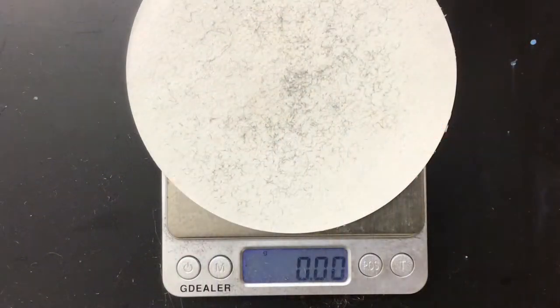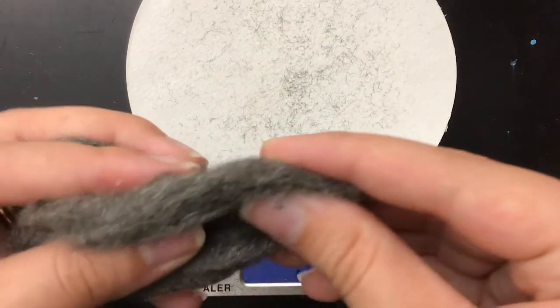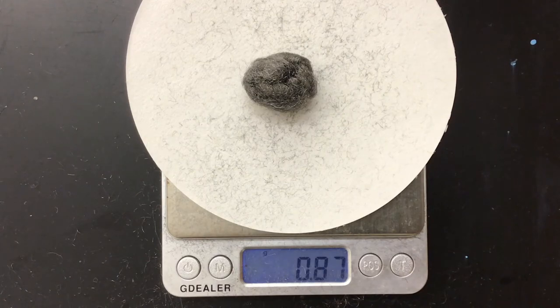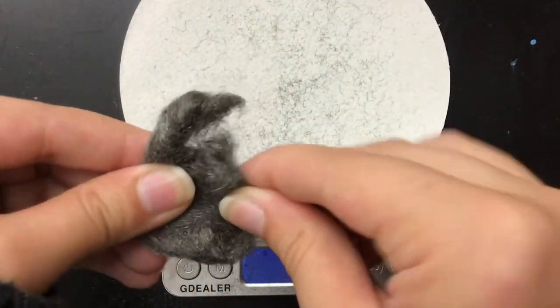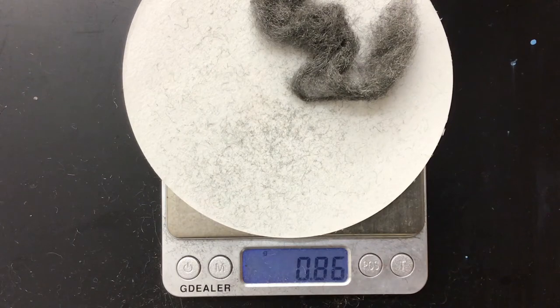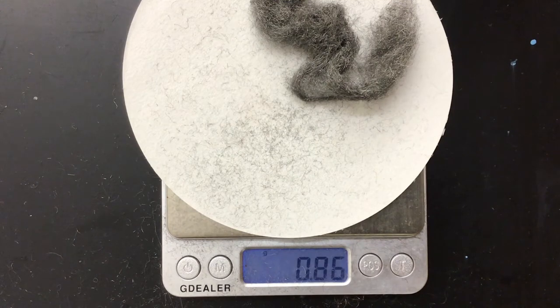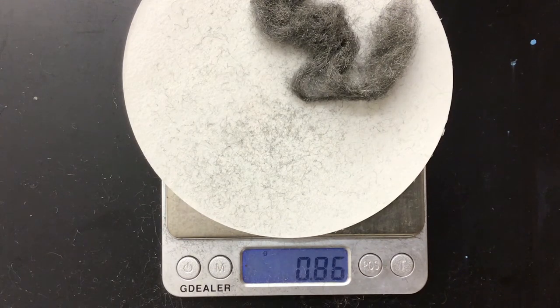Let's get started with station one. Here in station one, we are doing the mass of steel wool. I am taking a piece of the wool, I'm going to ball it up. I am going to measure the mass — it is 0.87. Then I am going to take this wad and pull it apart and take the mass again: 0.86, which is just about the same as my starting mass. Please determine if the mass of the expanded wad of steel wool is the same or different — in this case, it is the same. Please write down if you believe this is a physical or chemical change.